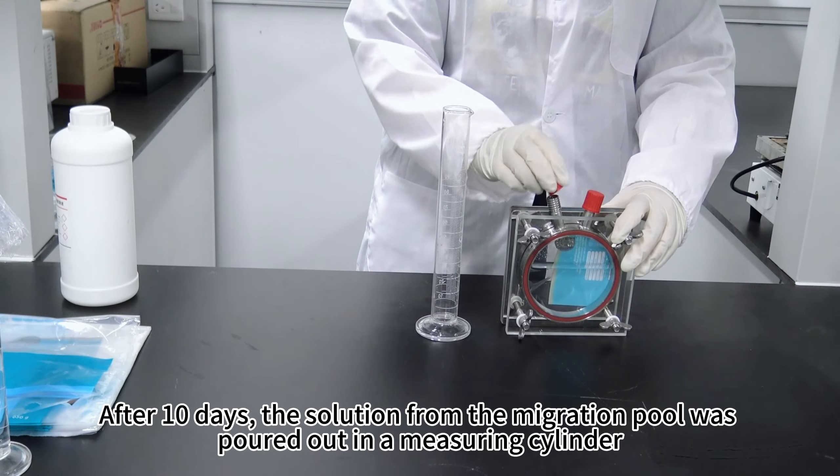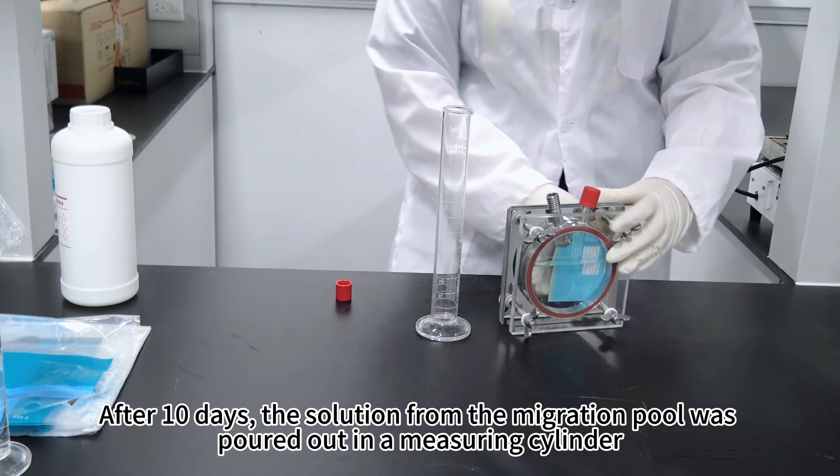After 10 days, the solution from the migration pool was poured out in a measuring cylinder.